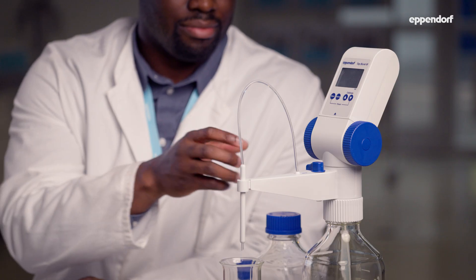One last pro tip: if you accidentally turn the wheels backward, don't worry — they run freely without affecting your dosing. There you have it, dripping made fun! If you like this content, please check out our other videos from this series, and I hope to see you there.